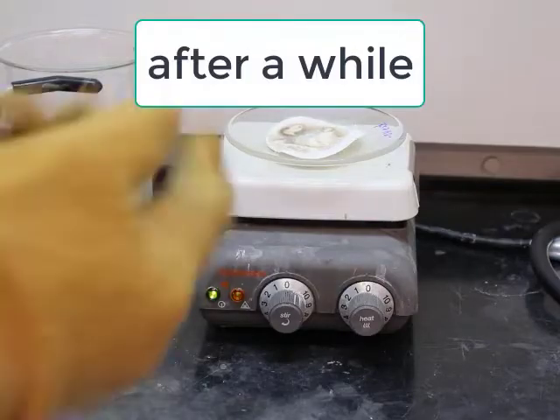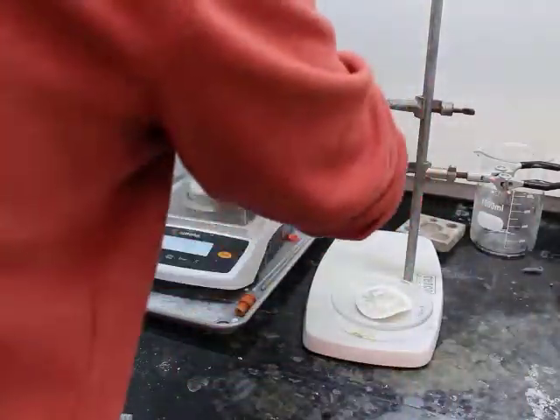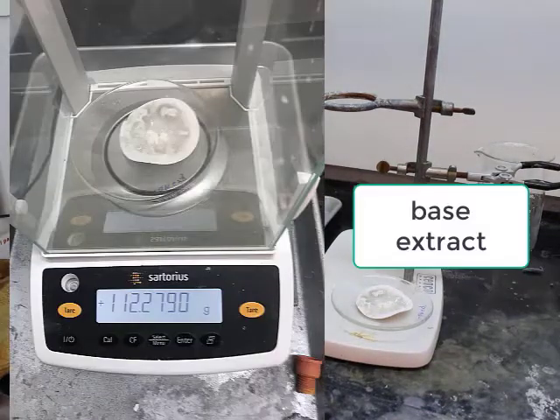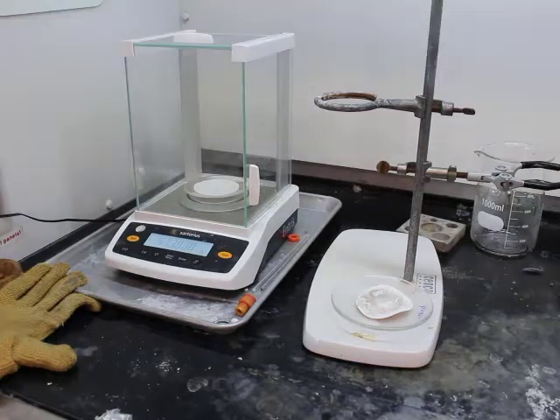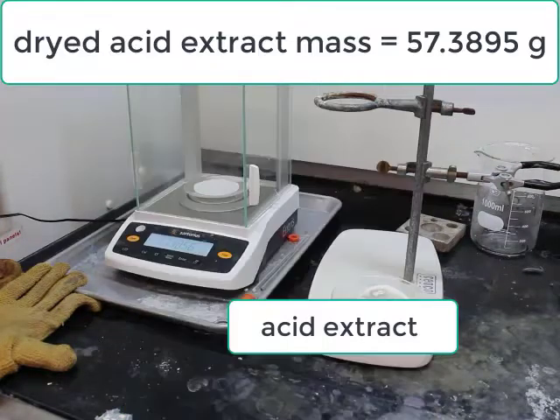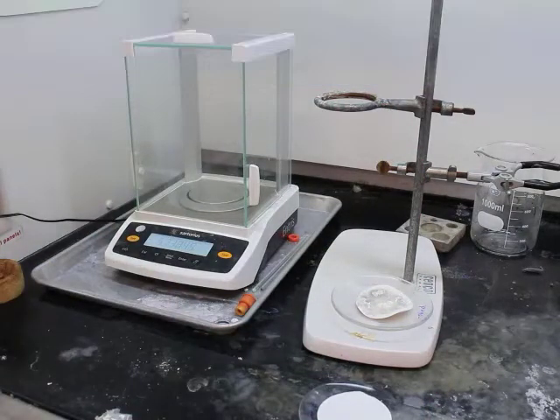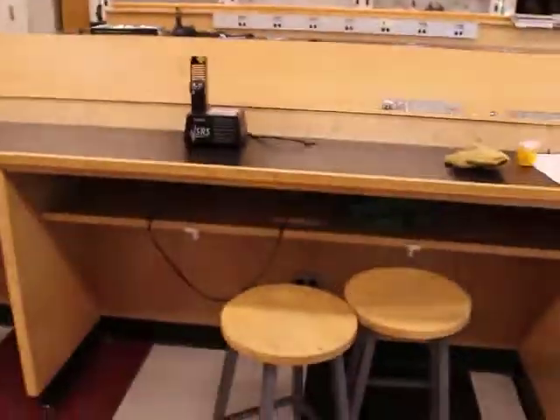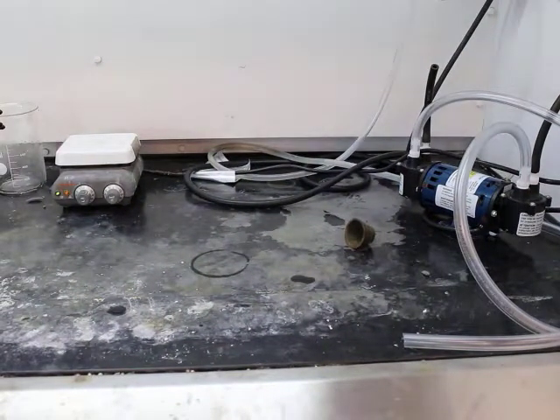All right, so now it's dry after a while on the hot plate. Now measuring out our dried solids on the watch glass and the filter paper. Our basic extract has a mass of 112.2790 grams. Our acid extract has a mass of 57.3895 grams. Now remember these masses, you do have to subtract those blank masses from them that we saw earlier.